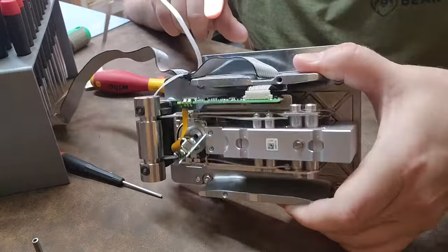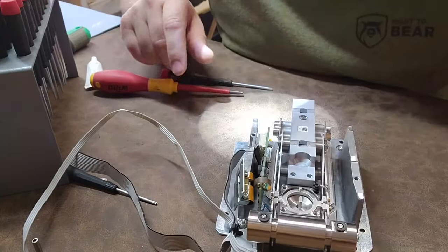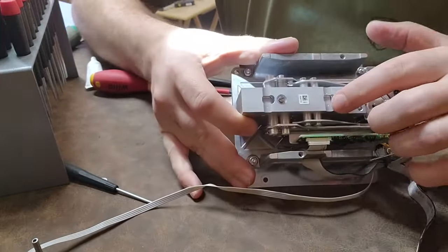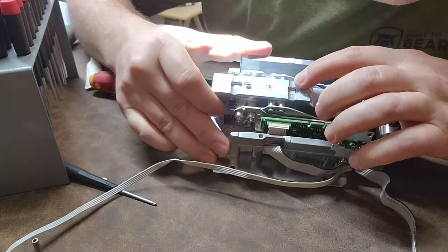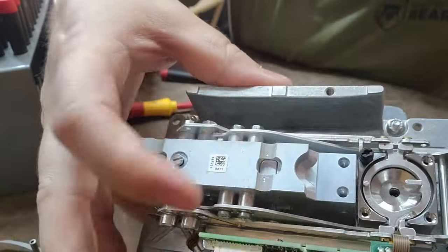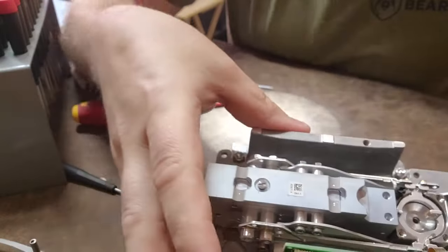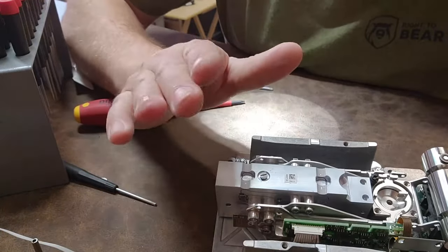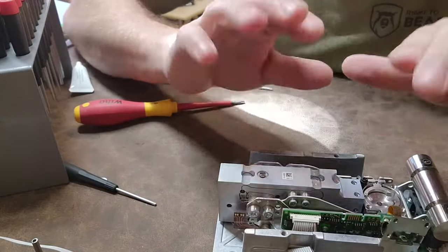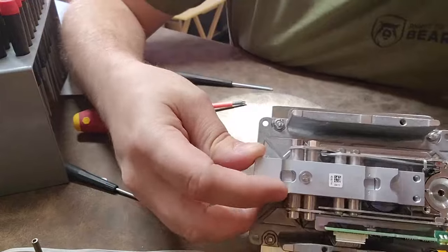This is something that was going to go to the trash and I decided to save it to show you guys. This scale probably costs thousands and thousands of dollars. I want to show you one more thing — see these little holes right here, and right here, and this tiny one right back here? Those little divots right there — that's calibration. They actually remove material from these indents so that it flexes nice and evenly. Load cells like this will have four different points of measurement, and they remove a tiny, microscopic amount of material from the flex point so it flexes evenly between all four points.